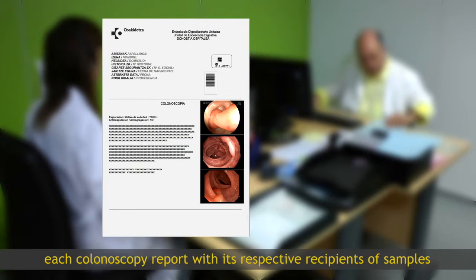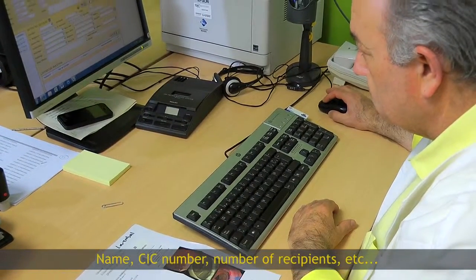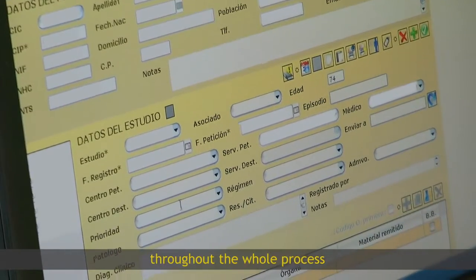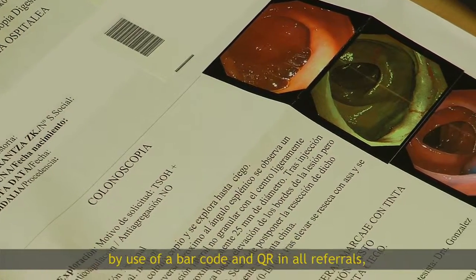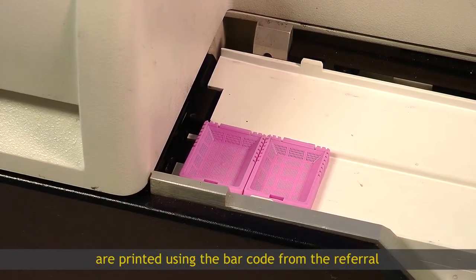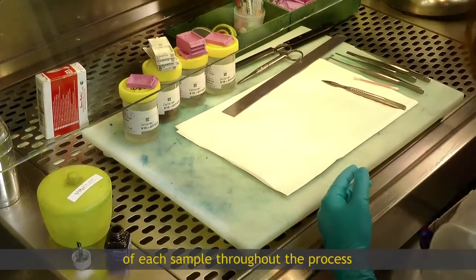Each colonoscopy report, with its respective recipients of samples, is registered in the anatomical pathology lab: name, CIC number, number of recipients, etc. They are given a code to guarantee their traceability throughout the whole process. From now on, the process will be controlled by use of a barcode and QR in all referrals, blocks and slides. Corresponding cassettes for each sample to be analysed are printed using the barcode from the referral. This code ensures the traceability of each sample throughout the process.